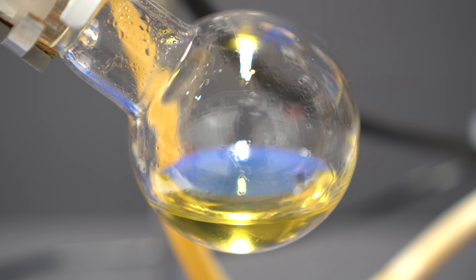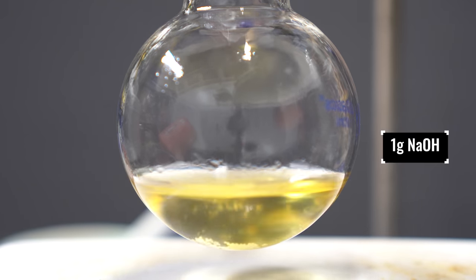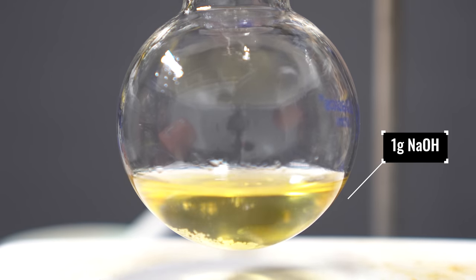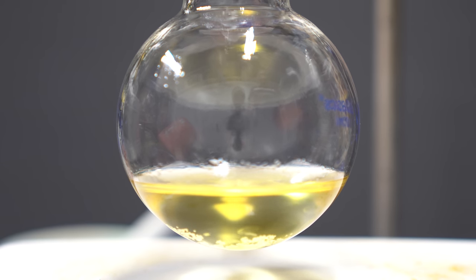We now have to take the water out of it, and set it for another distillation. To the flask, I added a stir bar, and I'm going to add 1g of sodium hydroxide. This will react with any niacin that's in there, and it will make it insoluble salt. The sodium hydroxide will also help to dry the pyridine. I let it stir for a while, however, no insoluble salt came out, and it was pretty much set to go for distillation.